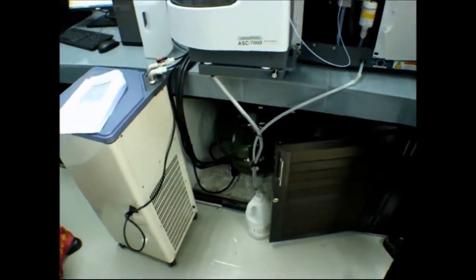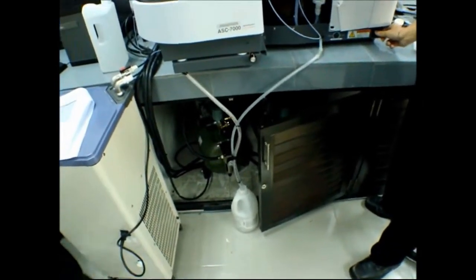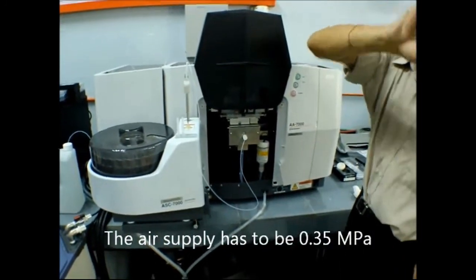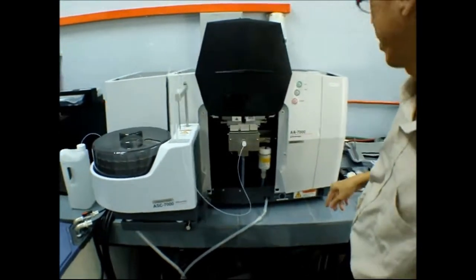Then we can switch on the instrument. What is 0.35? MPa. The pressure of the air has to be 0.35 MPa. That one is 0.09 MPa. All in MPa. If you want PSI, you need to convert. It's already on.